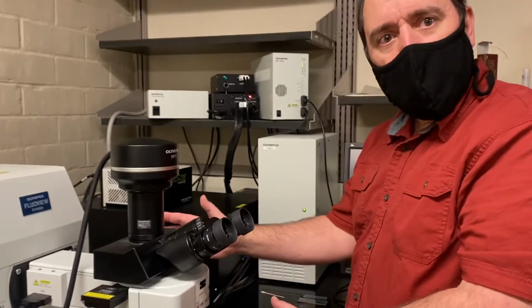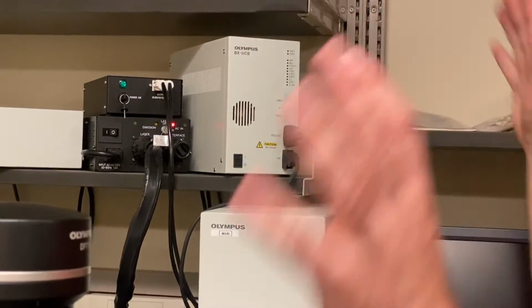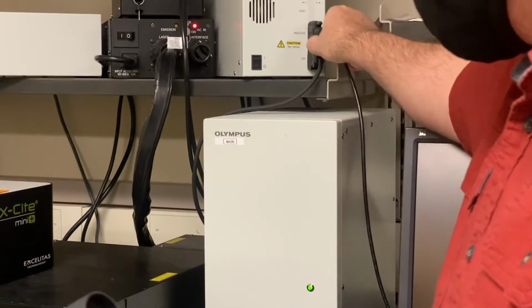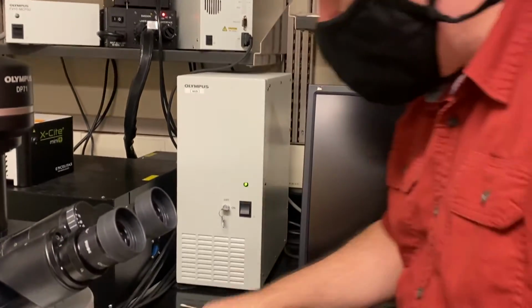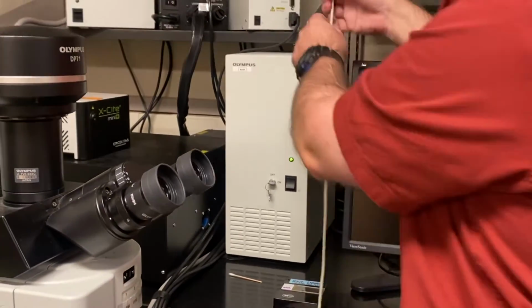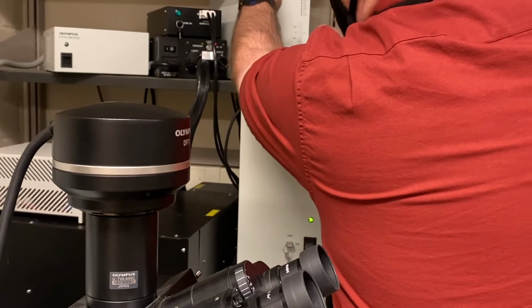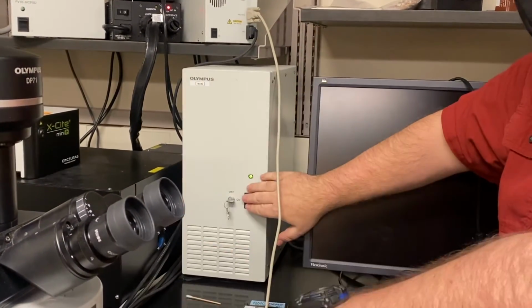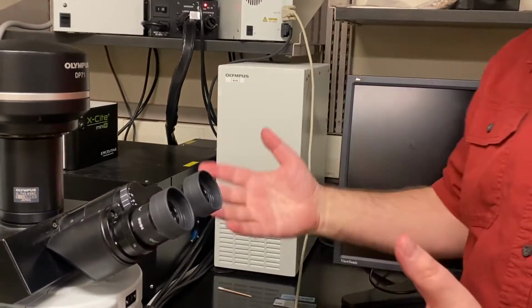What else do I still need to turn off? The power to the microscope. So I'll turn off the universal control box, because it's not attached to either computer. People always start with epifluorescence before they do confocal microscopy, so I'm going to hang this over here, and let's plug the other computer back in so it's ready for the next person to use. That's just, of course, a polite thing to do. And now we'll turn the power of the microscope off. So we're done with the microscope.